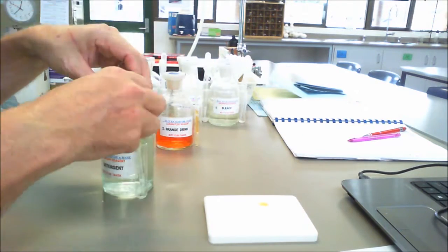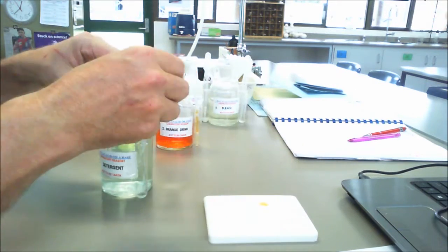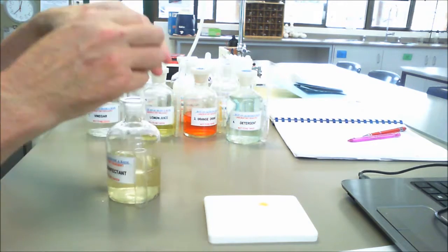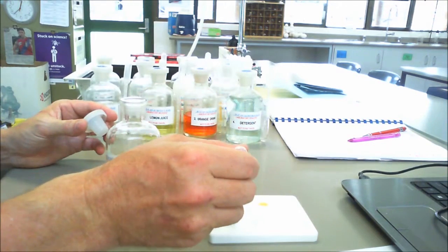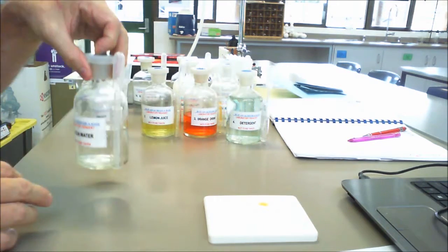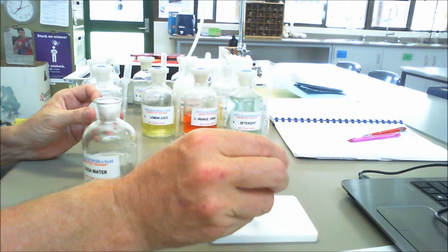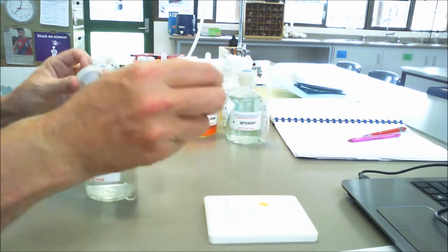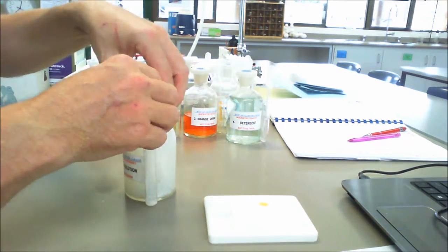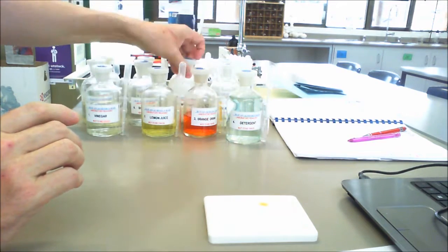Then we go to the first of our cleaning agents, which in this case is detergent. Then we come to disinfectant. So this is a liquid disinfectant here. And a lot of these we've made as a solution in order to be able to perform this practical. One is soda water, a reasonably popular drink. Okay, a couple of drops there. Then we come to soap, a standard sort of soap solution. So we can go in there.